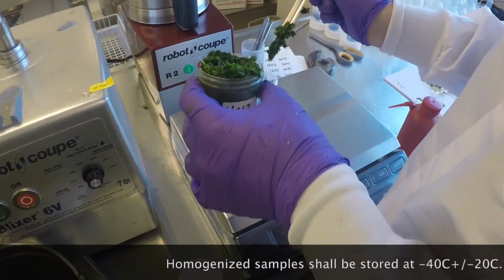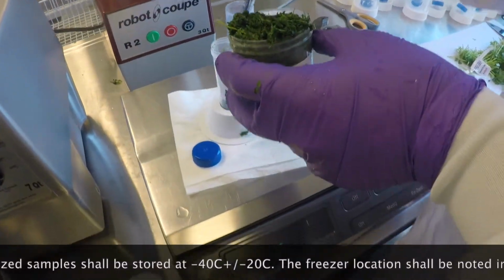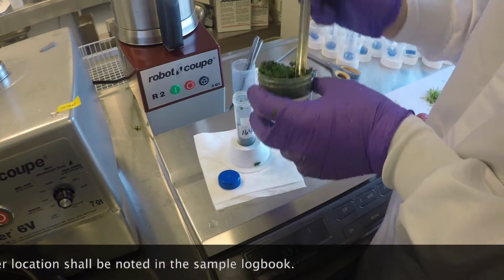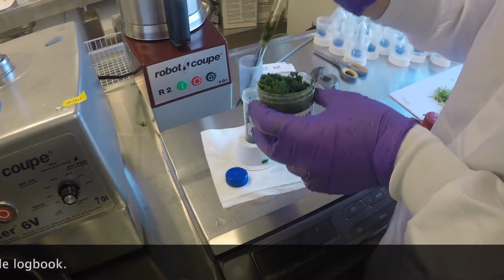The weight of one subsample shall be that required by the analytical method, currently 15 plus or minus 0.15 grams. The second subsample shall contain sample in excess of the amount that would be needed for a re-extraction.